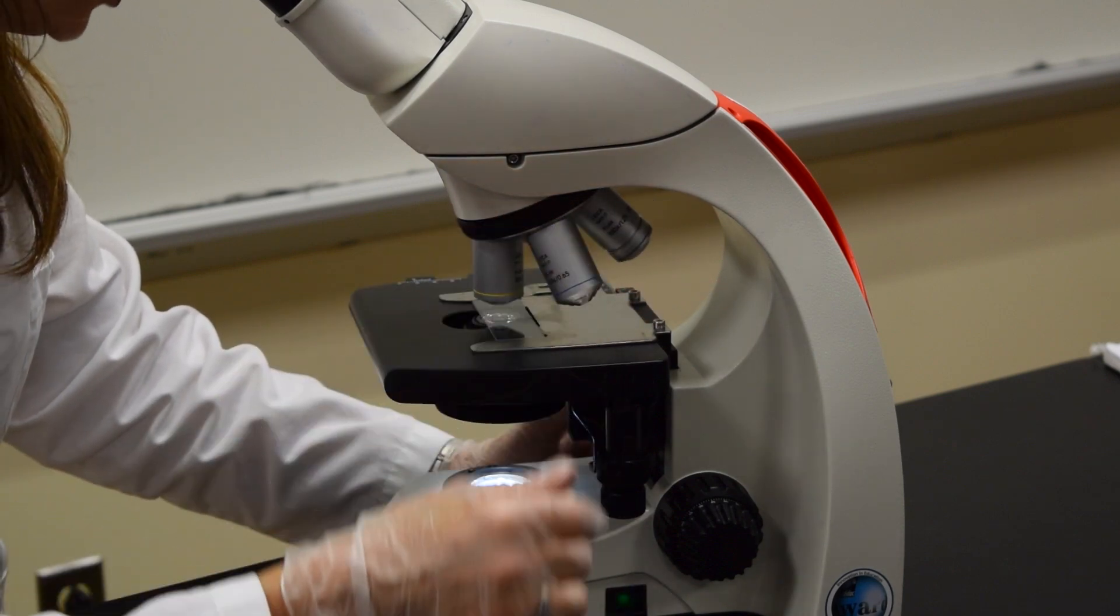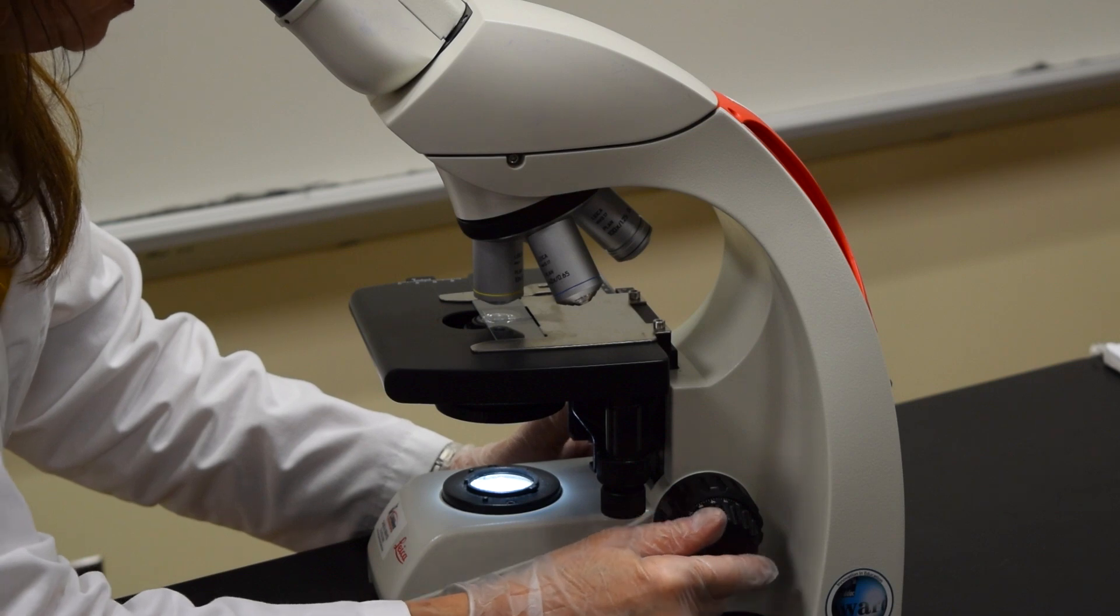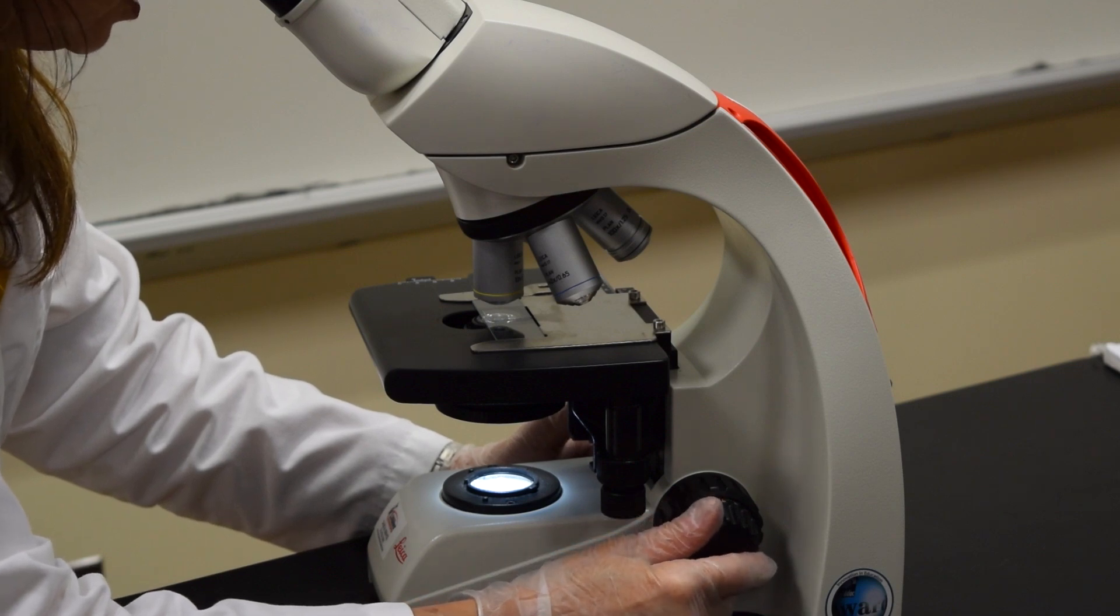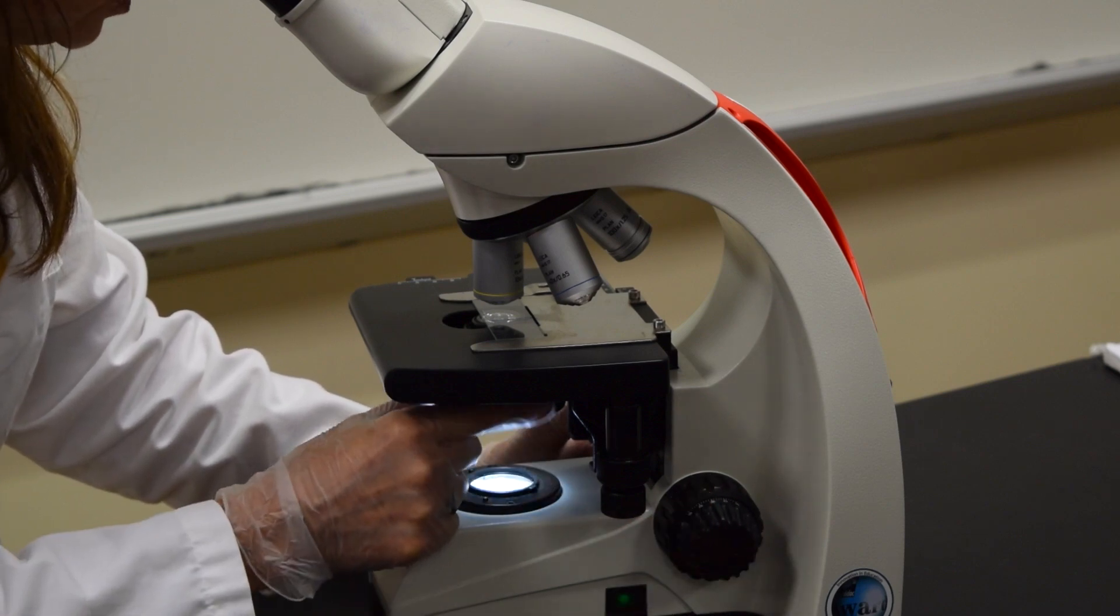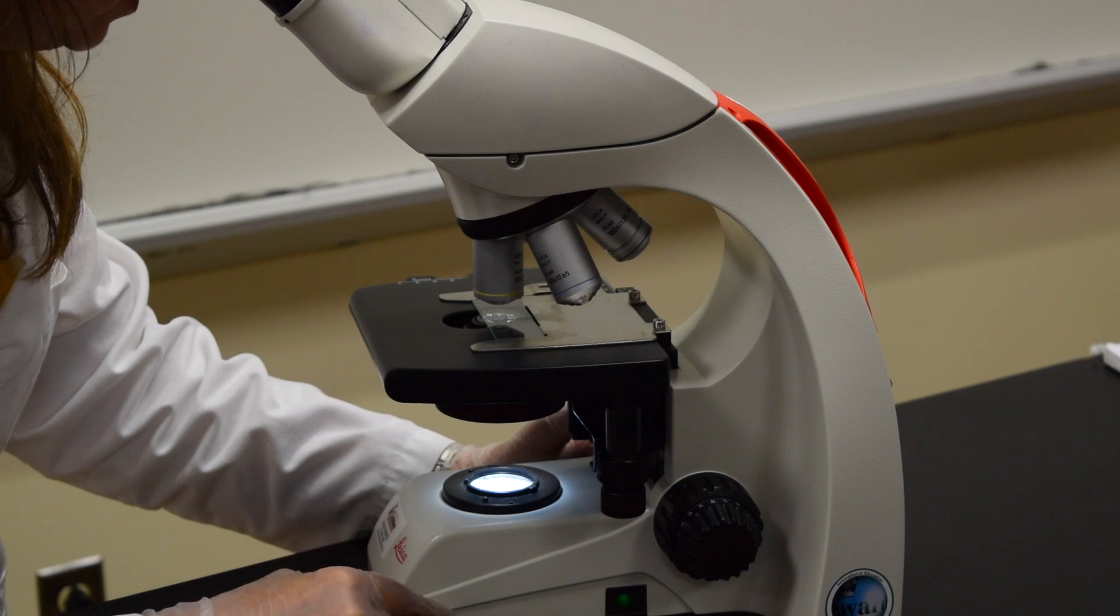Move the low power objective in place. From here on out, you're using your fine adjustment knob to get it in focus. If you need to dim the light, do so.